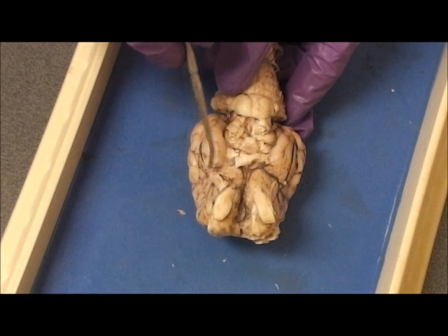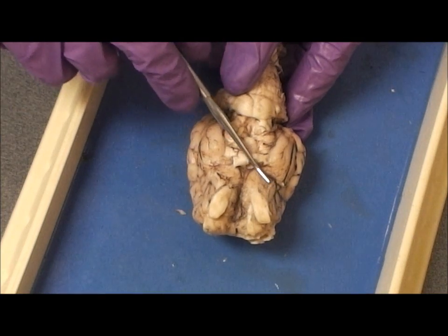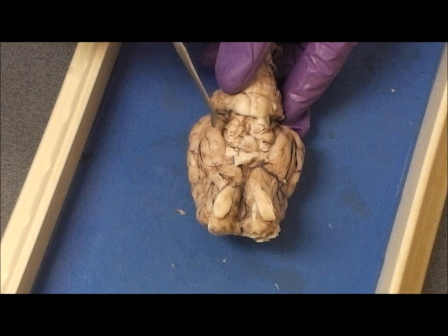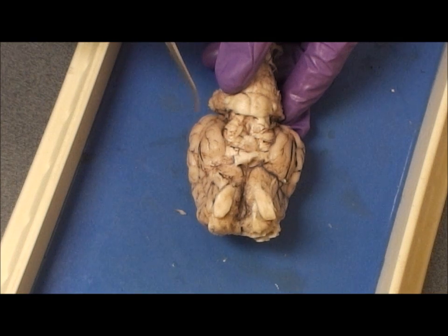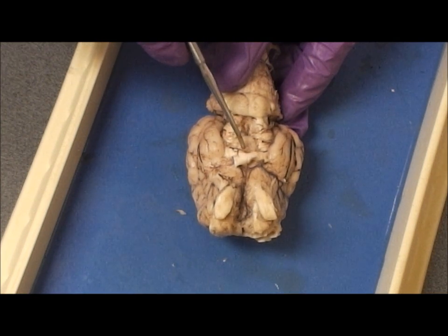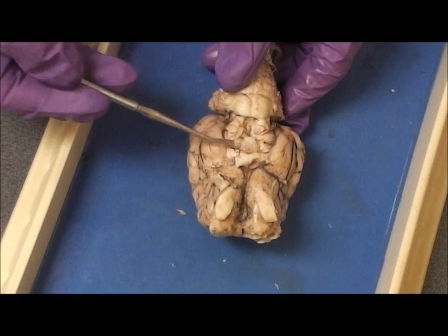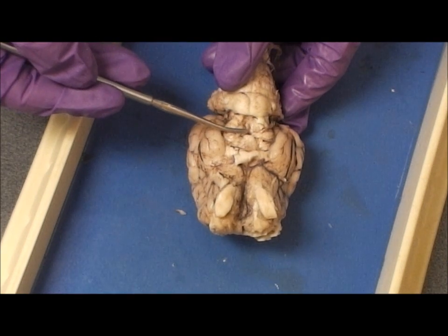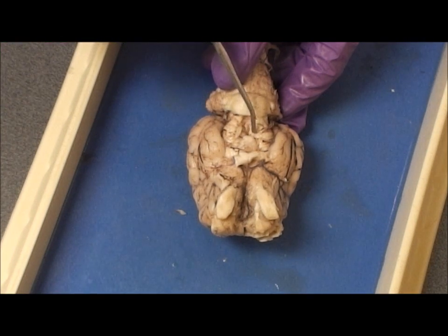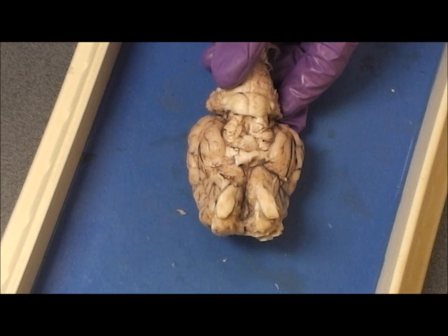I've removed the eyeball and unfortunately lost the other optic nerve. Here where the two optic nerves cross is the optic chiasm. This is the infundibulum, where the pituitary gland was attached. The most caudal part of the diencephalon is this structure, the mammillary bodies.